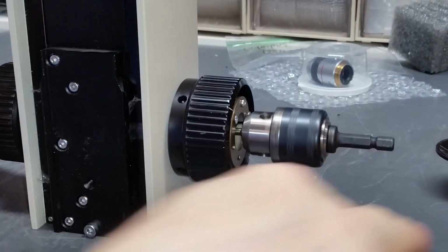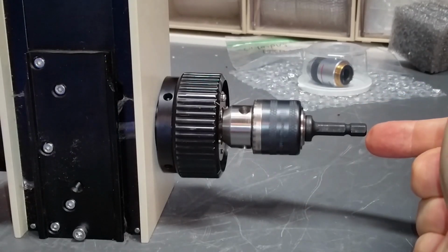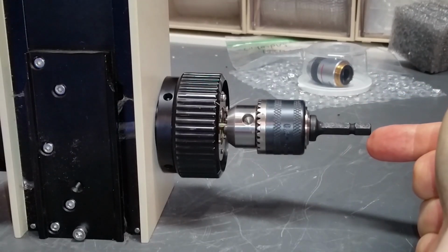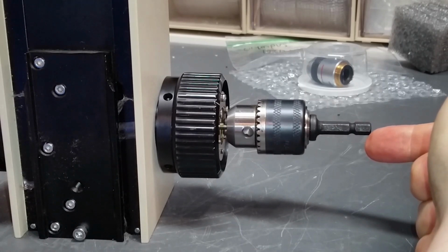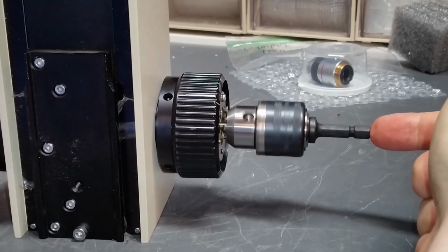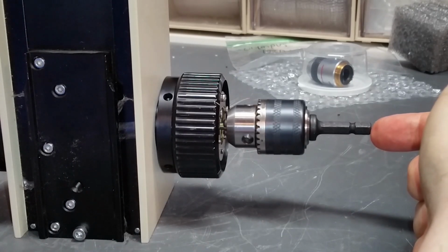There. Okay. So now if you look at that, you look right here, you should be able to see this going up and down as it rotates around. So that's indicative of the bend that's in the shaft. So all we've got to do is try to take that bend out of there. And if we're able to do that, then I think we'll have a scope that can be serviced and put back into use. It'll be good for somebody.